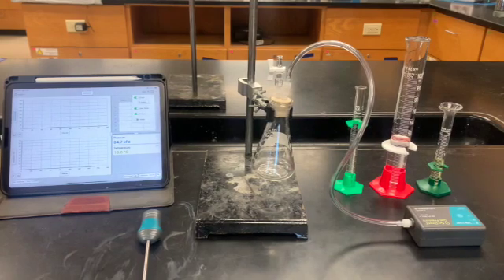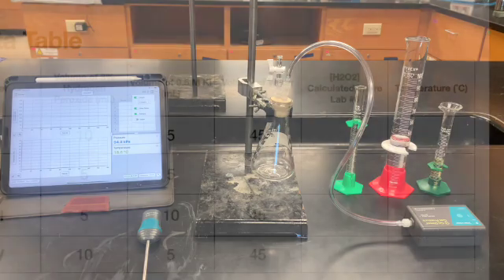Okay, you have 4 runs to do. Make sure you look over the table, and it will tell you how much for each run you're going to have of the hydrogen peroxide, the water, and the KI. Your 4th run needs to be done at a low temperature, so you're going to put that in a cold water bath, or you may put it in the refrigerator while you're waiting to do that run. So that's going to be the 4th run where we lower the temperature. We want that temperature to be at least 10 degrees cooler than the room.